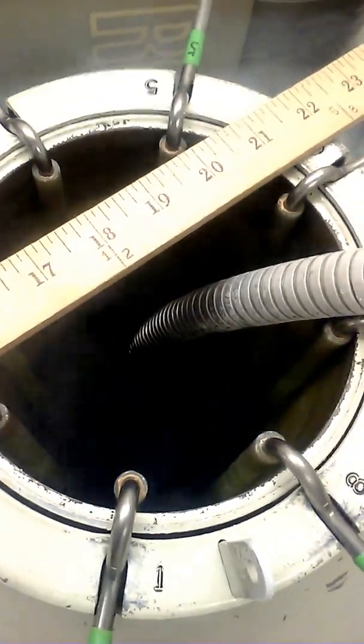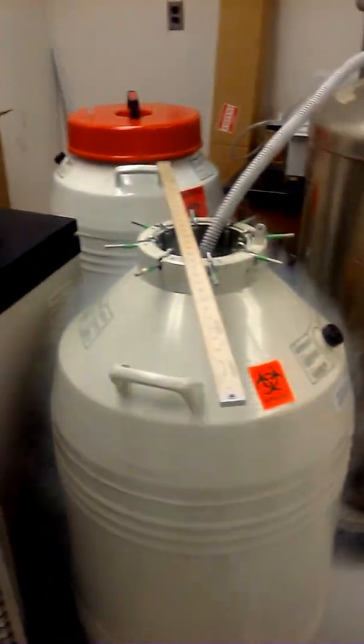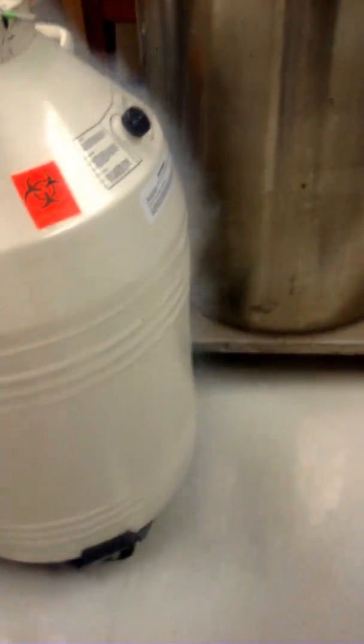These are some of the cell tanks that we're filling up. Also, we need to have the door open so that we have good air exchange. You don't want to do this in a closed room because you could suffocate yourself by filling the room up with nitrogen gas.